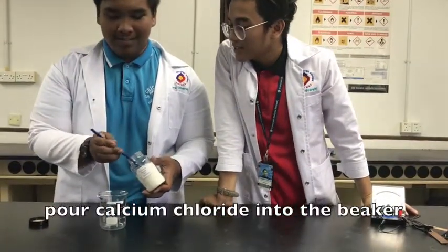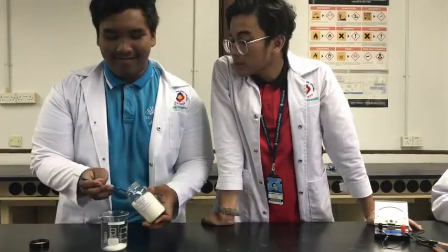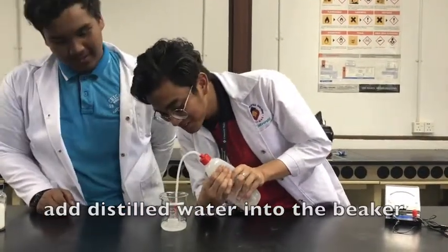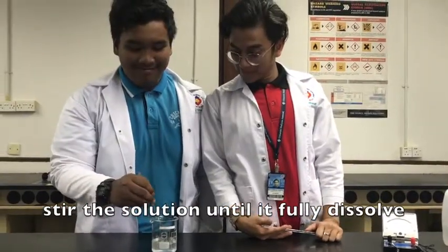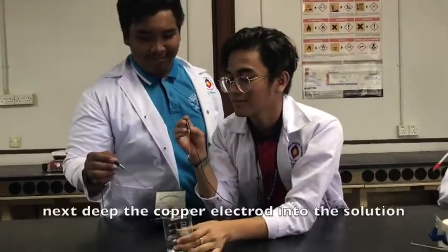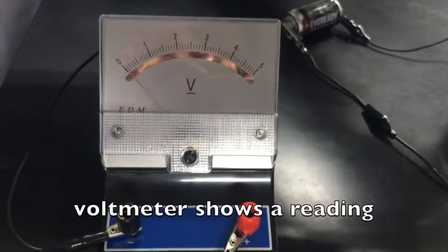Pour the calcium chloride into a beaker. Then, add distilled water into the beaker. Stir the solution until the calcium chloride is fully dissolved. Next, dip the copper electrode into the solution. The voltmeter shows a reading.